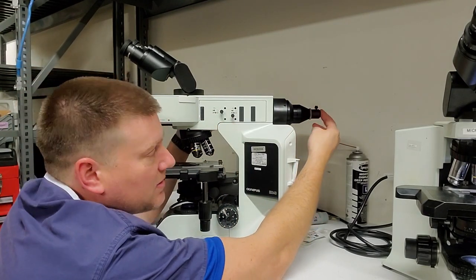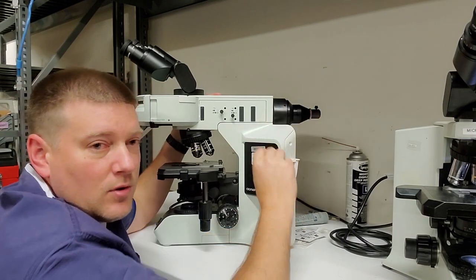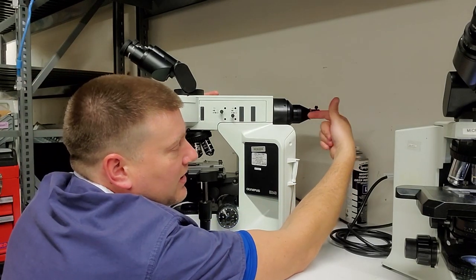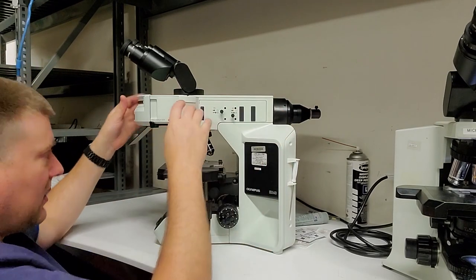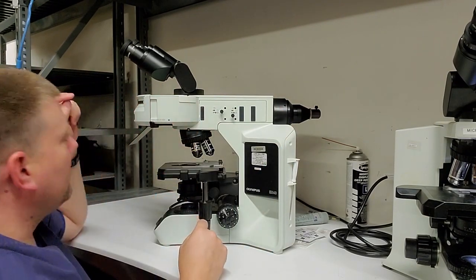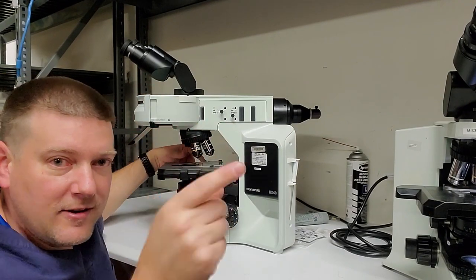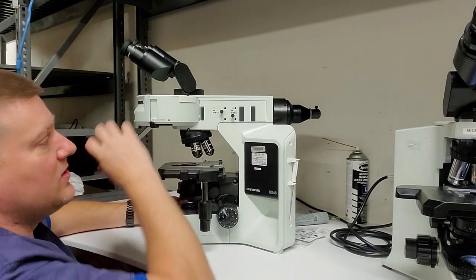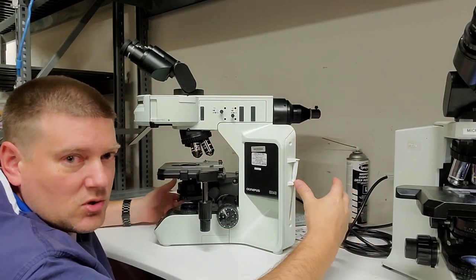You see this nozzle coming out the back? That right there is an optic where a fiber optic will connect. So the fiber optic, it's a tiny little one. It connects right here, and then this spreads the light, okay? And then that light comes up into here, and this guy right here, being fluorescence, it shines light on your sample at a different angle than what a traditional bright field does. So that's what this headstock is, and there's an external light source, just like a surgical light source.